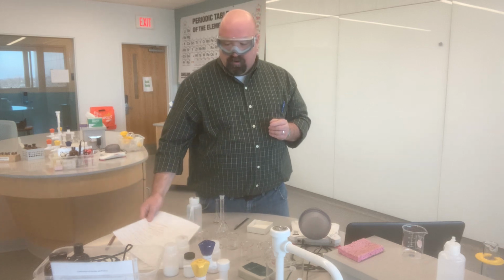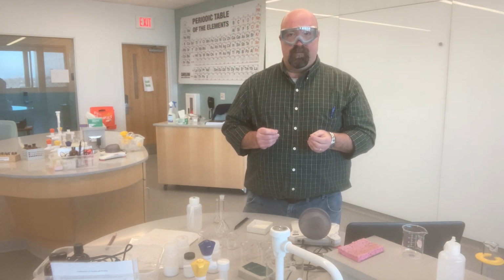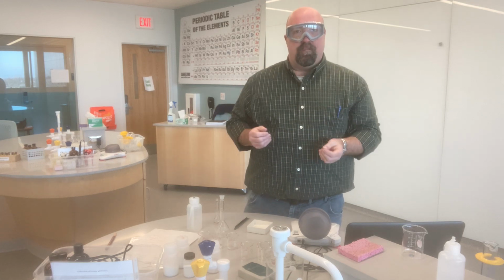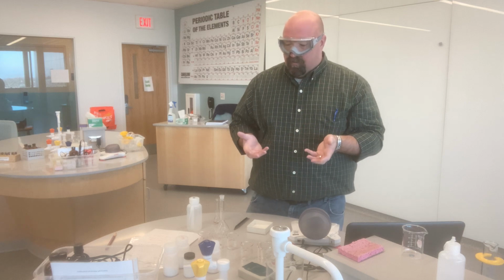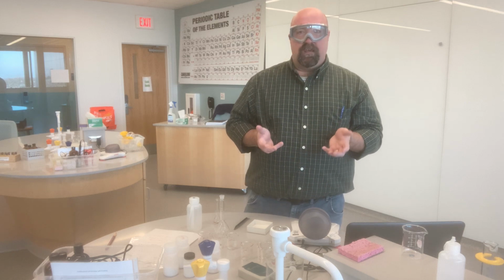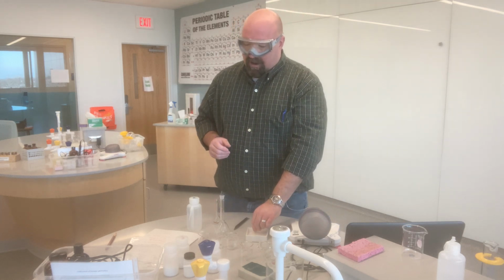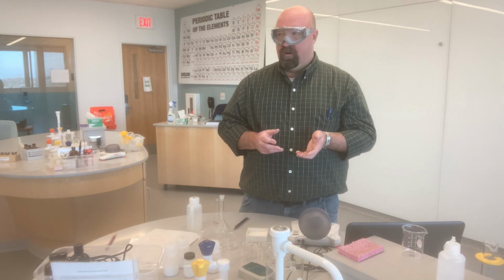The first thing that we have to do today is to create a whole bunch of different solutions. And so, like I said, I've already done the calculations, as you've done for your pre-lab activities, for what the mass is of the various solids that I'm going to need in order to make my solutions. The first one that I need to make is 100 milliliters of a 0.025 molar ammonium nitrate solution.